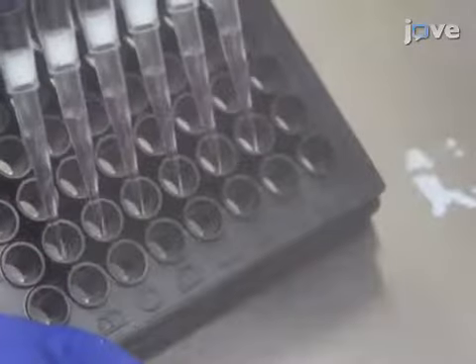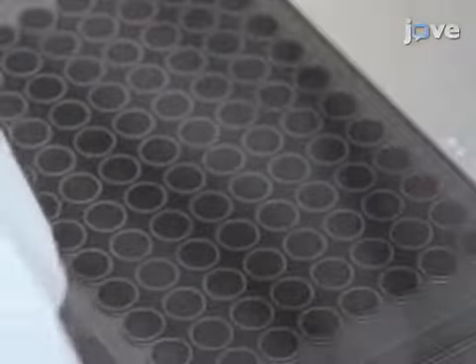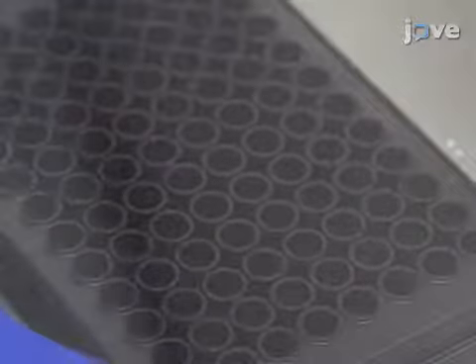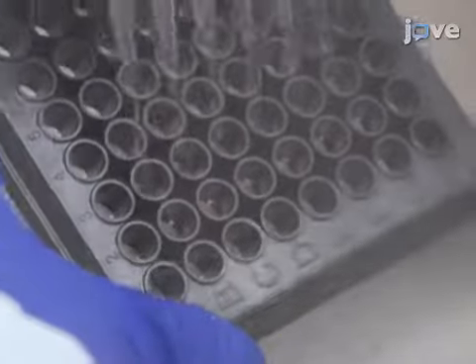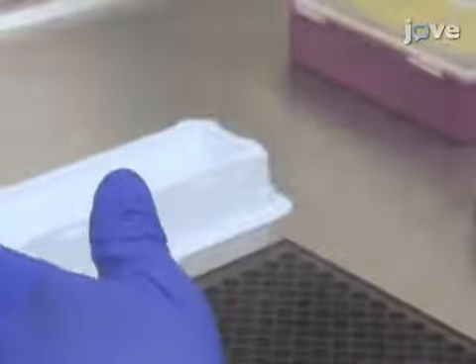Using a multi-channel pipette, seed a total of 1500 cells in 100 microliters of RPMI in the wells of a 96-well plate. Plate each cell suspension in triplicate with identical plate setups for each time point.